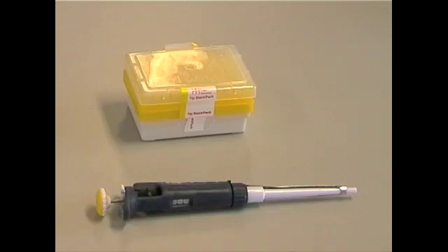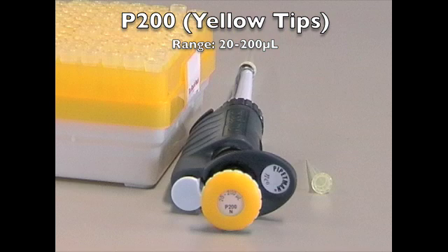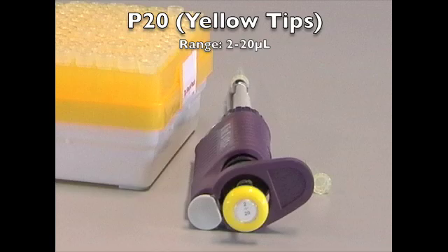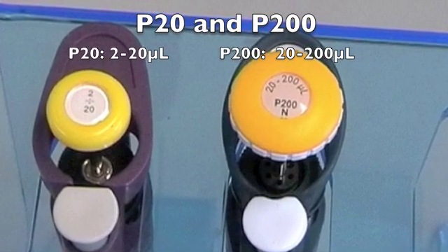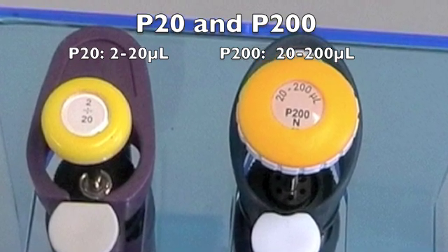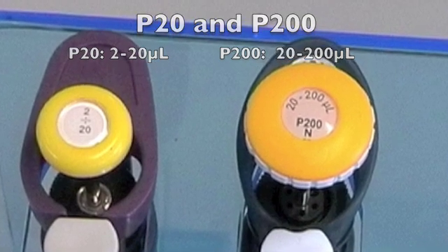The P200 has a range of 20 to 200 microliters and should only be used to measure within this range. The P200 is compatible with the yellow tips and will not work with the blue tips. The P20 has a range of 2 to 20 microliters and should only be used to measure within this range. The P20 is also compatible with the yellow tips, much like the P200. Once again, the ranges are 2 to 20 microliters for the P20 and 20 to 200 microliters for the P200, and neither pipette should be used outside of this range.